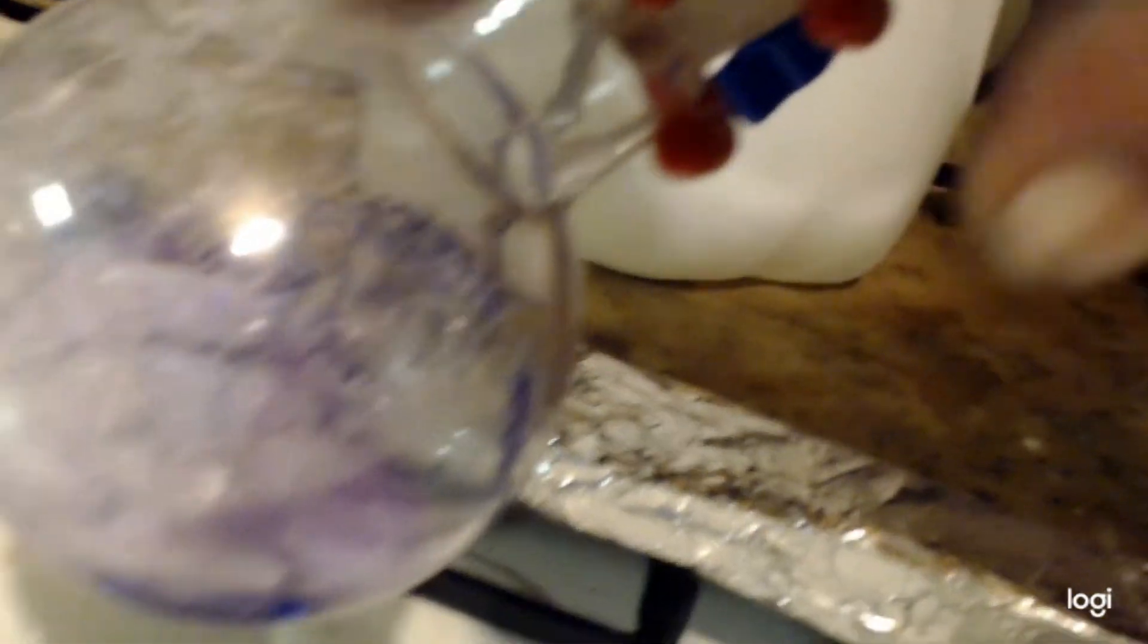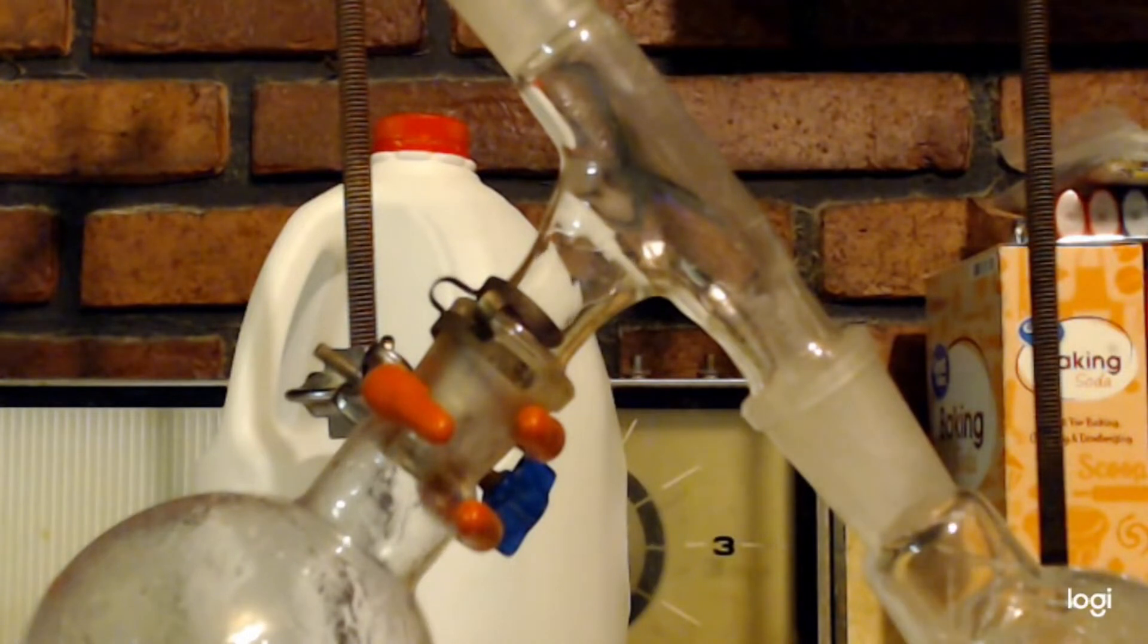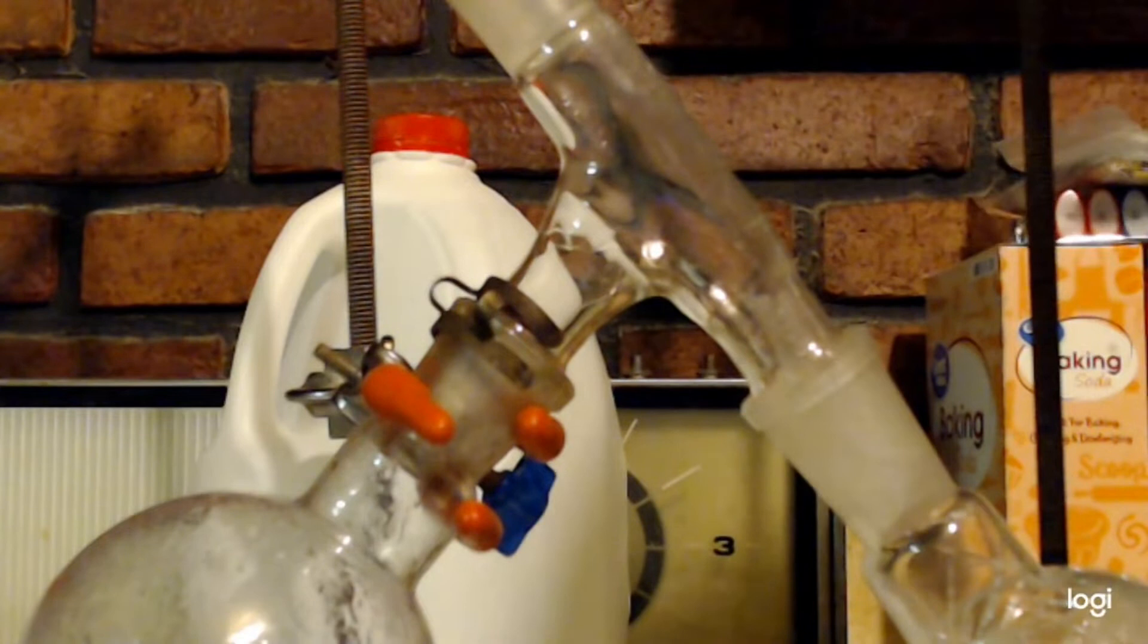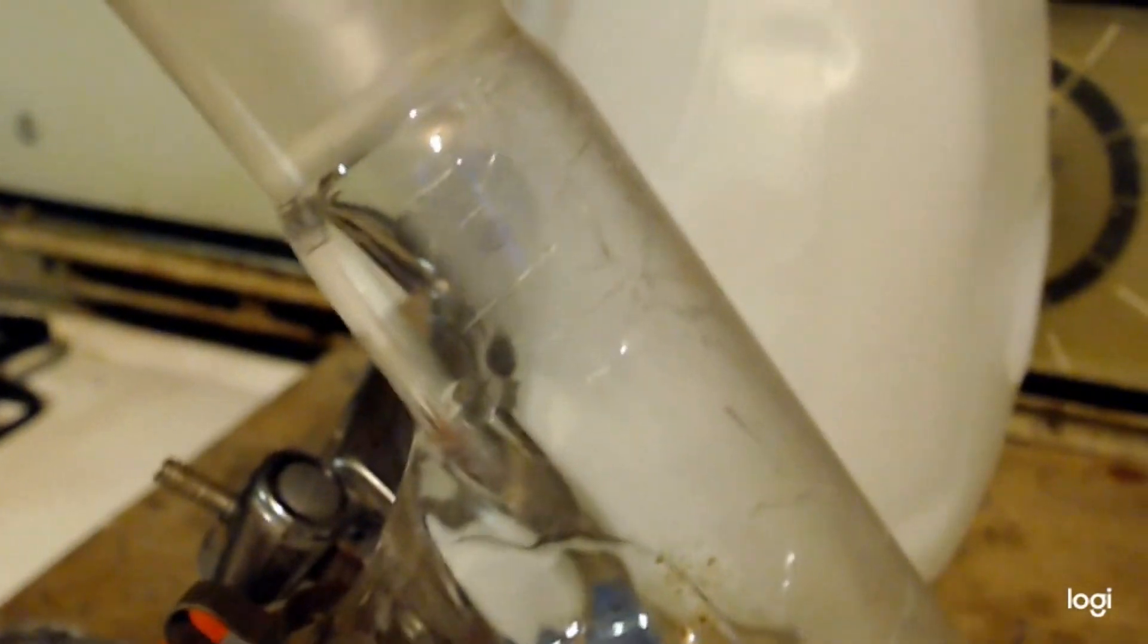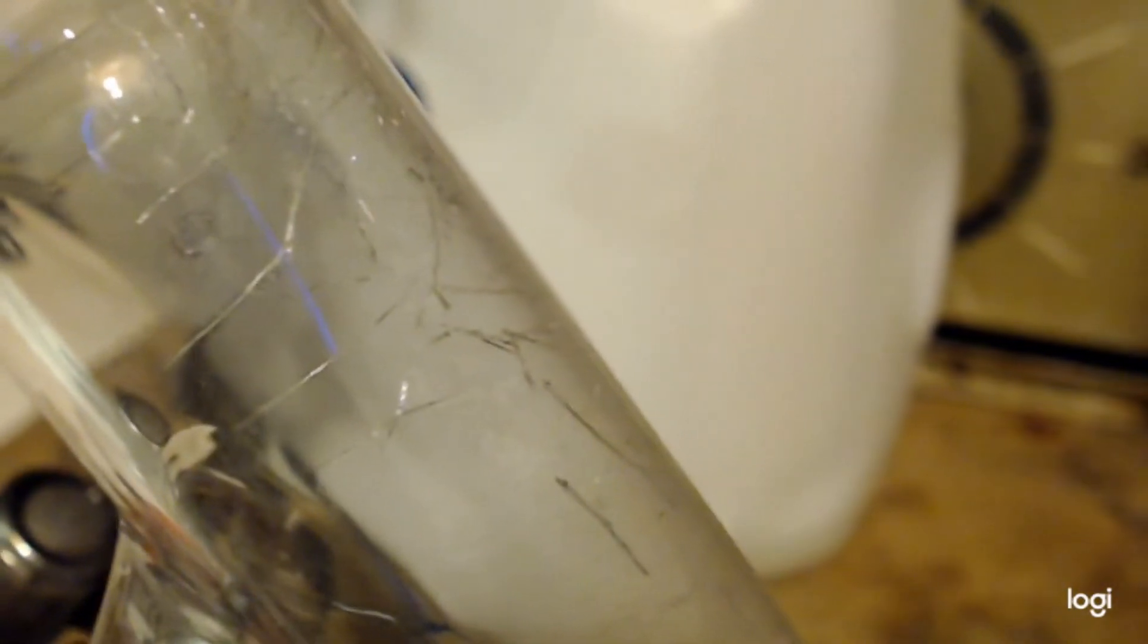You can see the crystals starting to form. I don't know if you can see it or not, but it's actually starting to come over a little bit. Looks like the glass is cracked, but it's just crystals forming. See those are crystals not cracks.